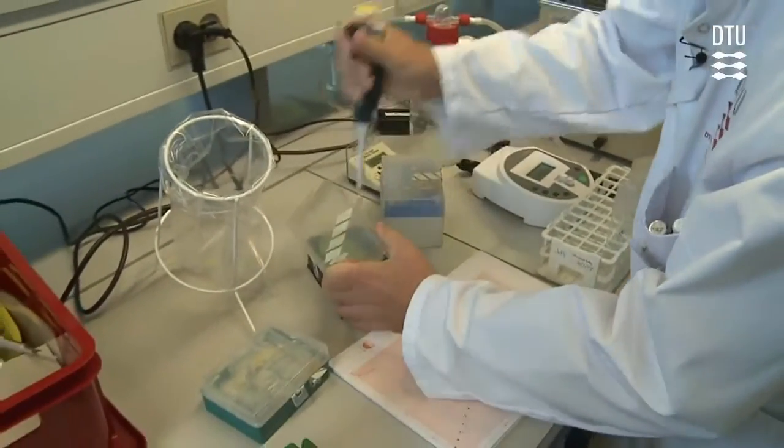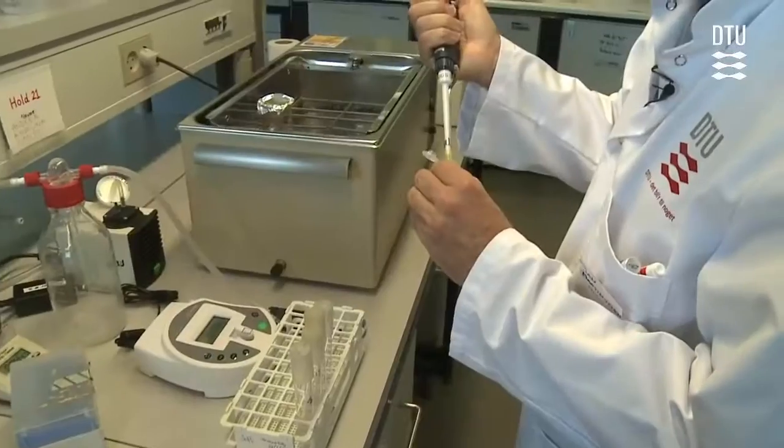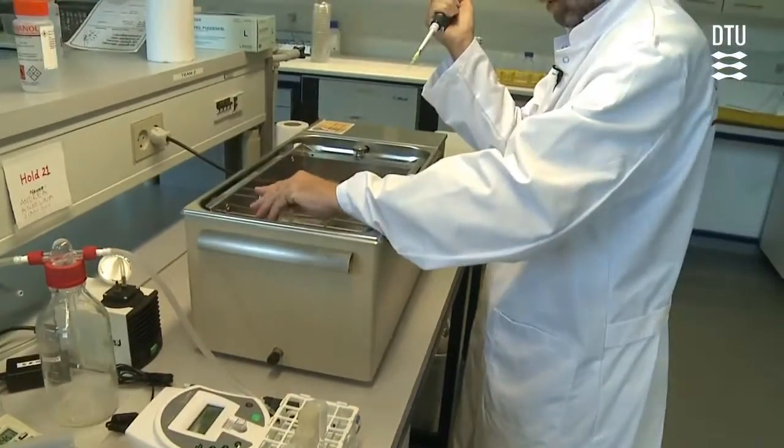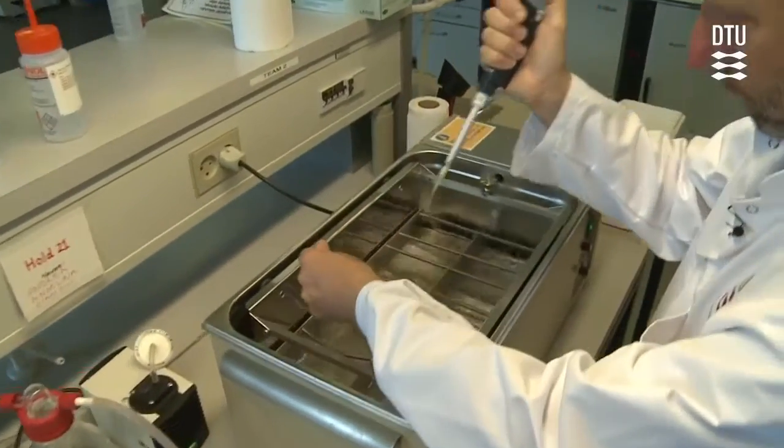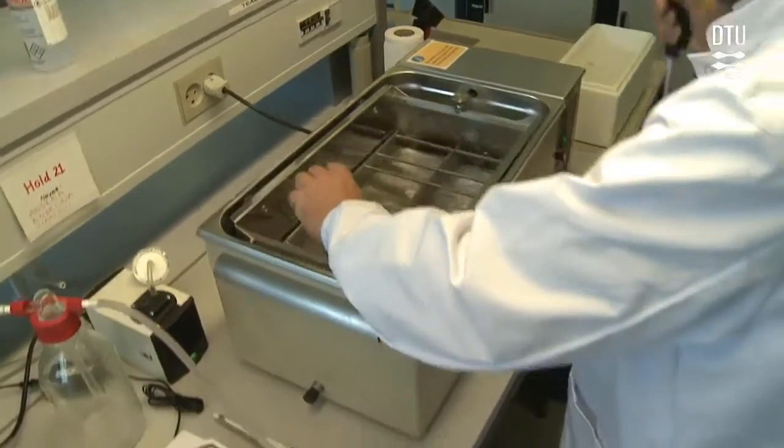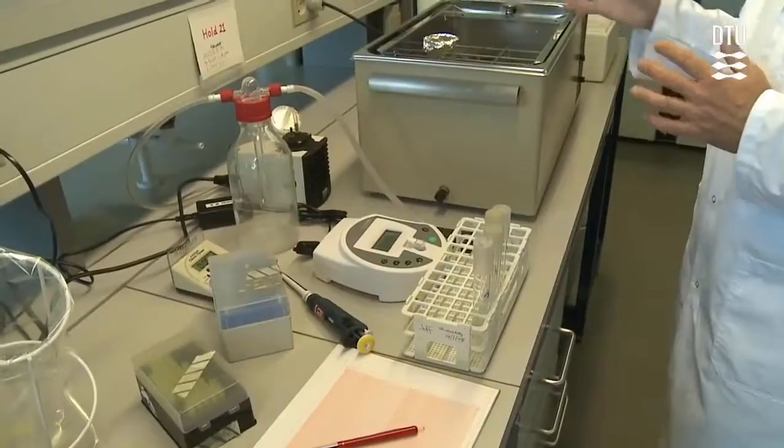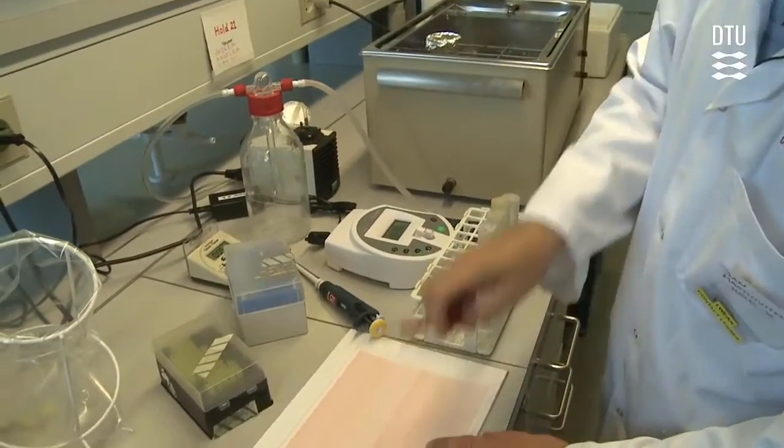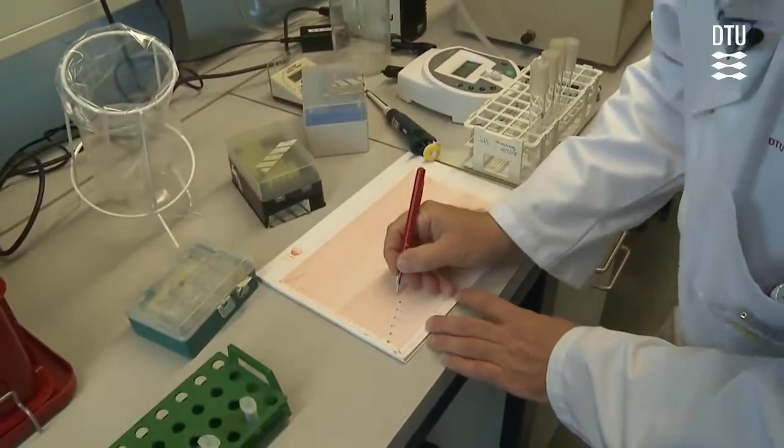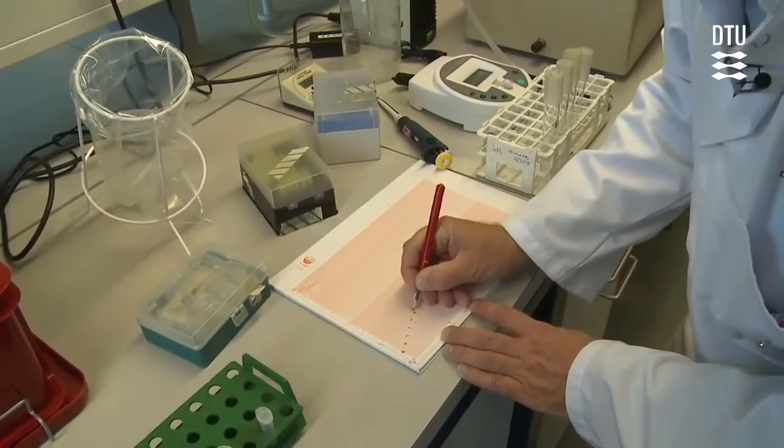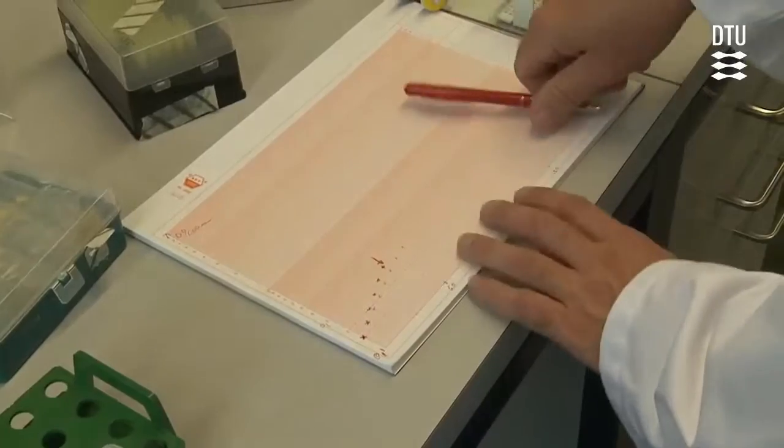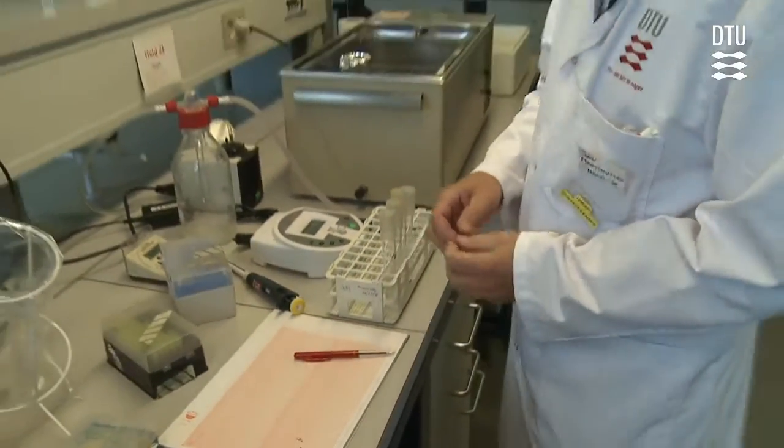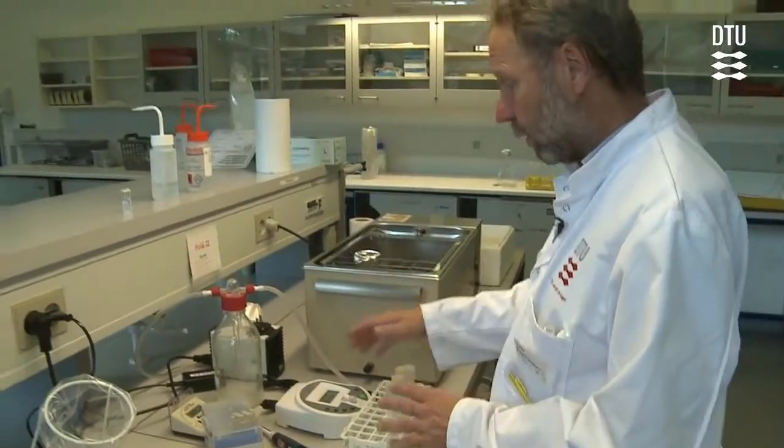After that, we are now ready to add penicillin. We add penicillin, note the exact time, and down it goes. Now we mark at what time we add the penicillin and keep following the development of the growth by measuring the optical density.